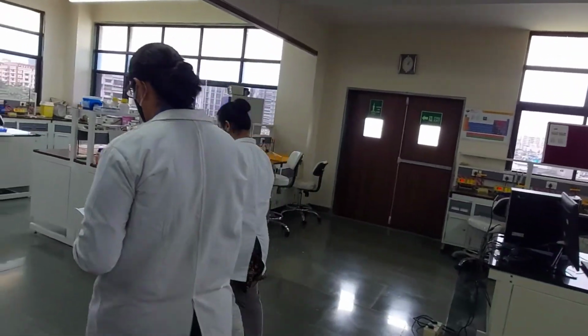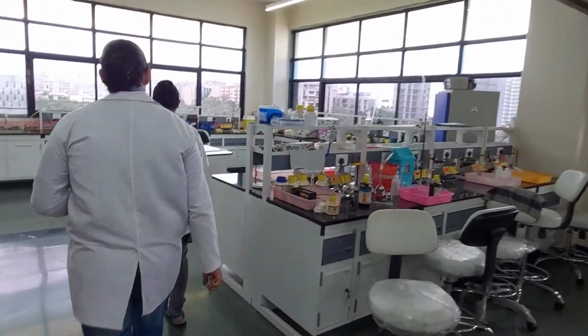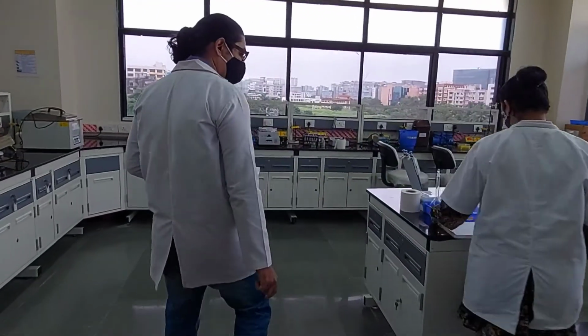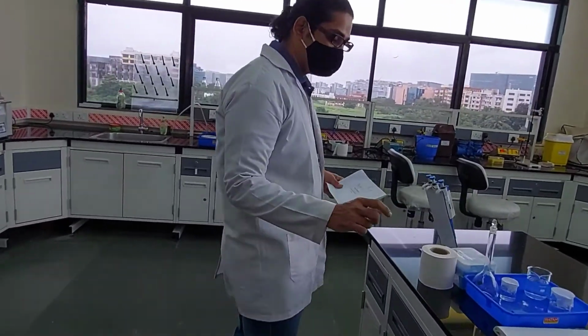Now let's begin. Let's go to the experiment bench and see how things are to be done, right? So here we are.